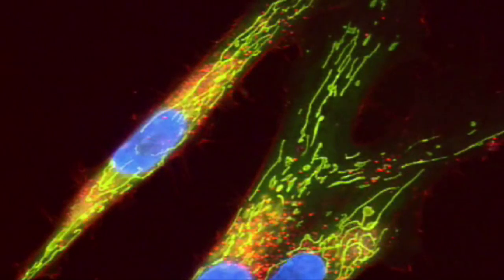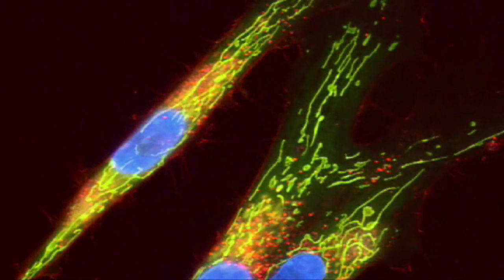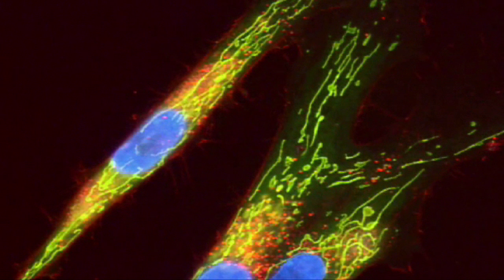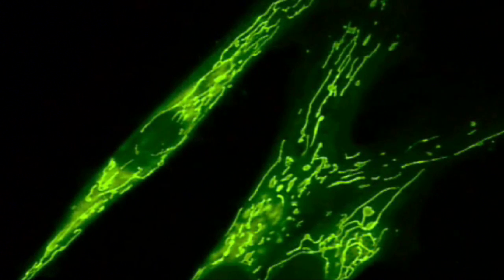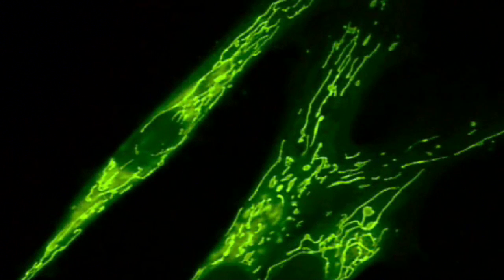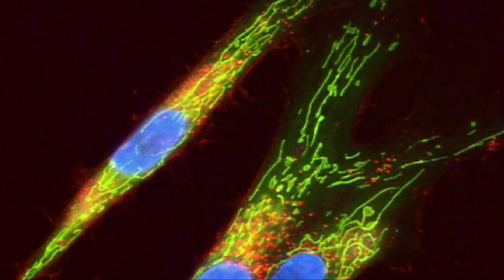These are fibroblasts, the most common cells of the connective tissue in mammals. We can see here the blue DNA stain, the extensive green mitochondria stain, and the red stain specific of microtubules, identifying the cell skeleton.